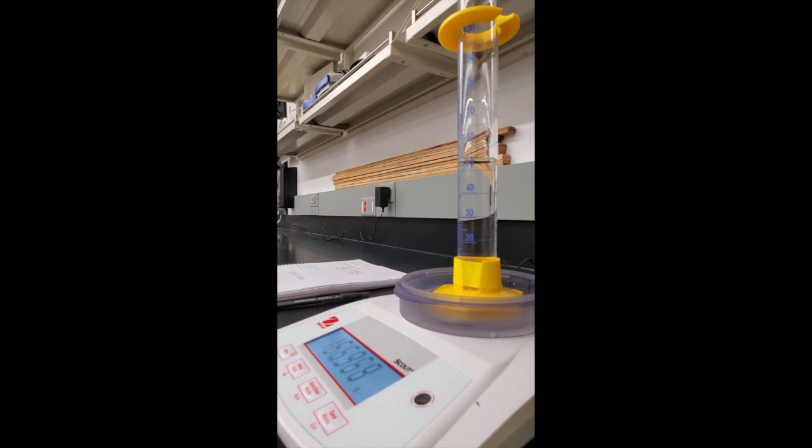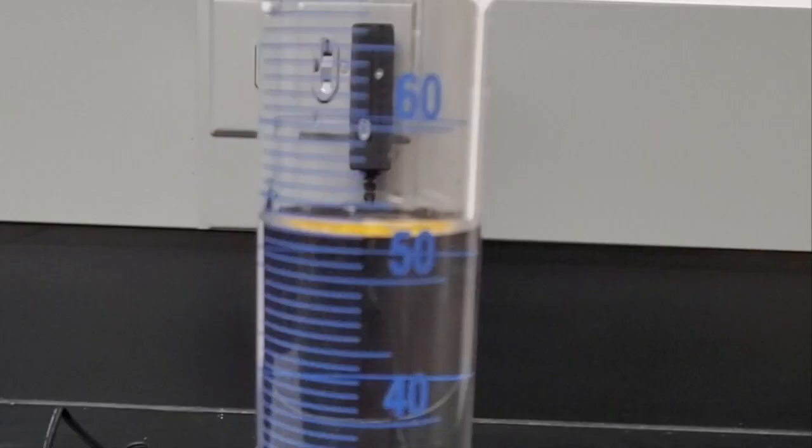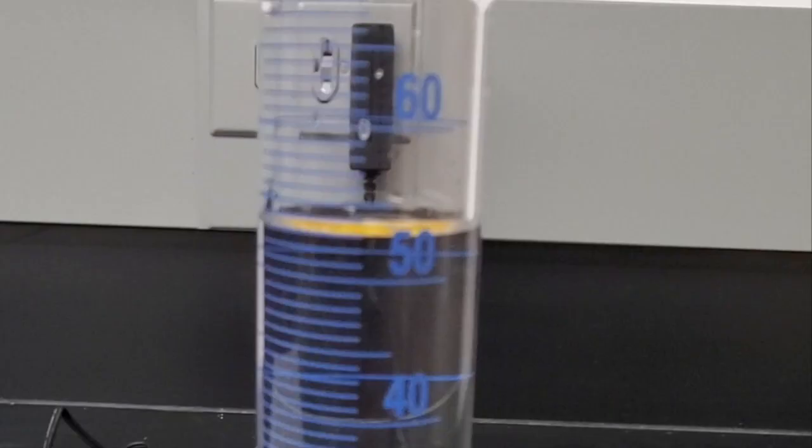Now we add more solution for a mass of 166.968 grams. The new volume is 53.0 milliliters.